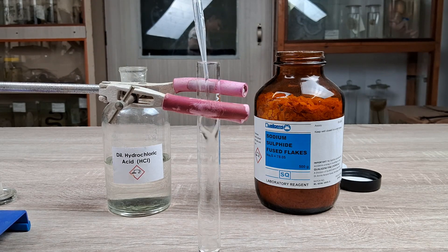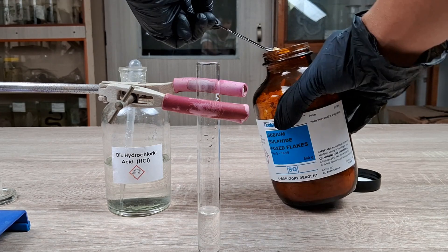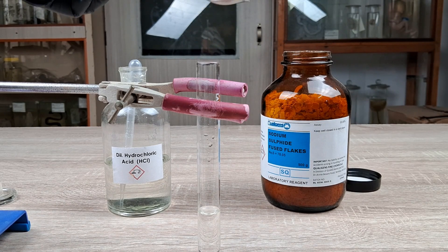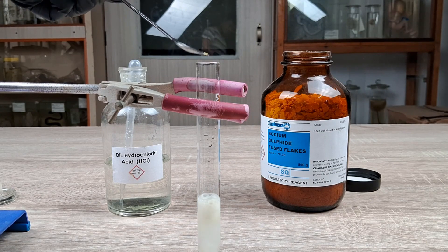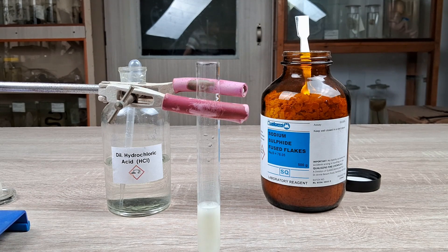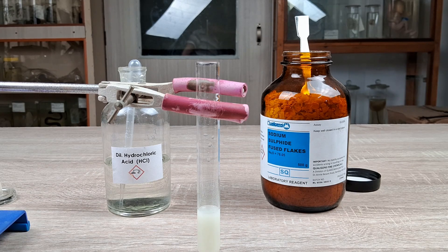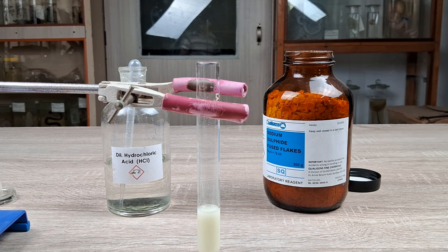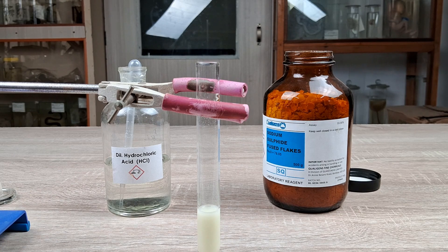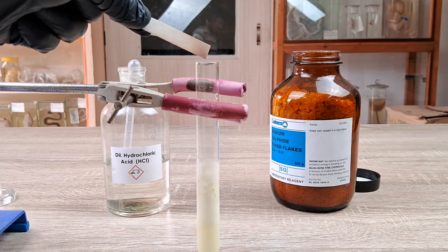To perform this gas formation reaction, fill a test tube with 5 to 10 ml of a dilute acid such as hydrochloric acid. Add solid sodium sulfide in small increments and observe carefully. A brisk effervescent reaction takes place between sodium sulfide and hydrochloric acid. Bubbles of a gas are released from the surface of the sodium sulfide flakes. A slight whiff of the gas gives a characteristic odor of rotten eggs. If you introduce a strip of lead acetate indicator paper near the mouth of the test tube, the white strip turns black.